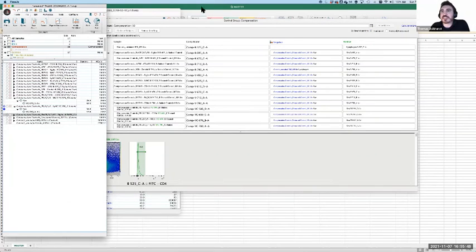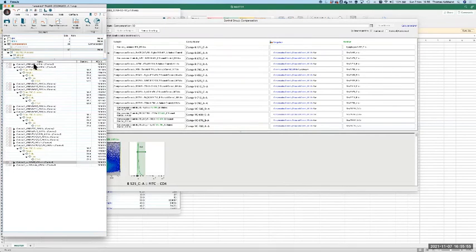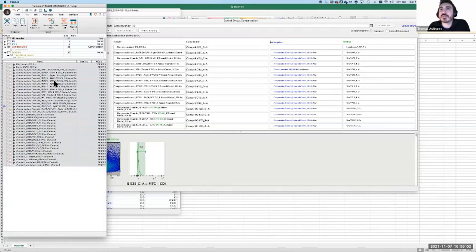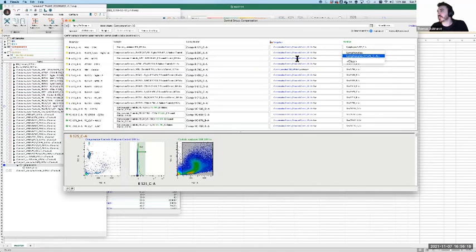Well, yeah. Because I've tried putting an unstained in there and just putting two arbitrary markers, and it didn't work. Damn. Do I even have something in here called bone marrow unstained? Controls unstained. Oh, it's that one. Okay, yeah, let's give this a shot. I'm really curious now. Yeah, let's go. Unstained control, that'll do. Let's see if that does anything.